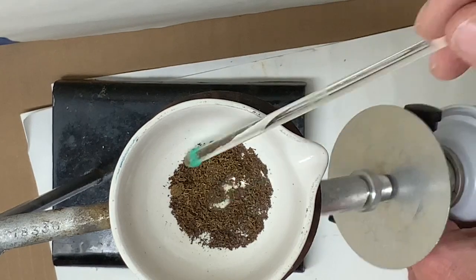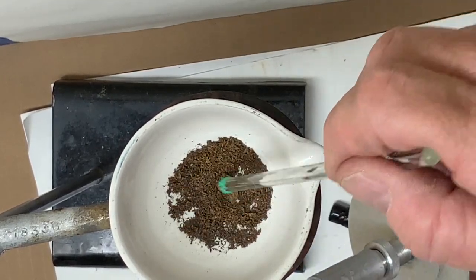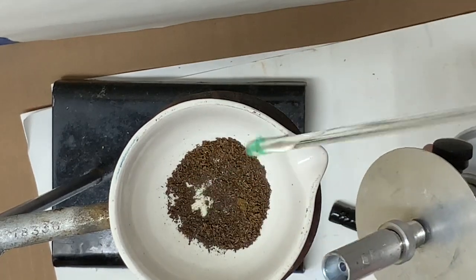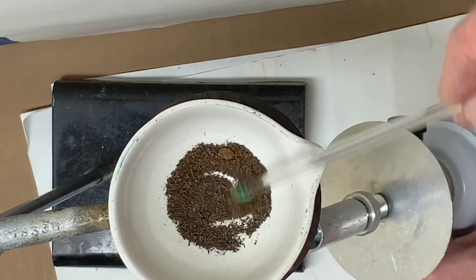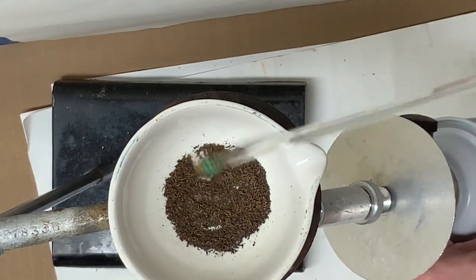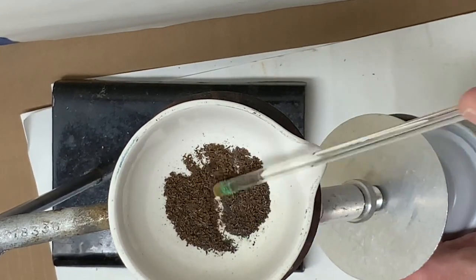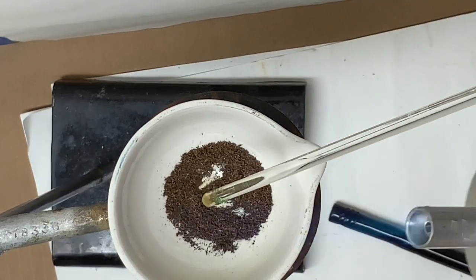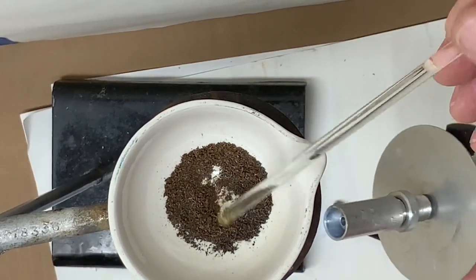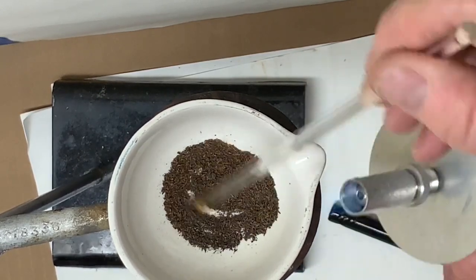I will work very hard to eliminate the green hydrate from the stirring rod so that error is not introduced into the measurements. Leaving the stirring rod in the dish so that it will warm up will remove the water from the green hydrate that is still on the stirring rod, causing it to dry out into the anhydrate and then fall off the stirring rod and end up in the dish where we want it to be.